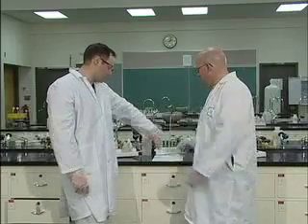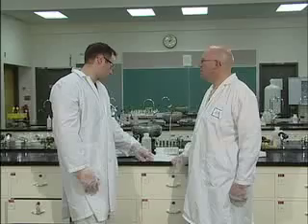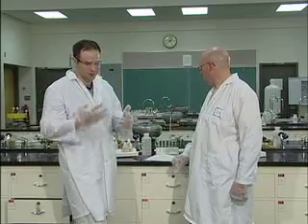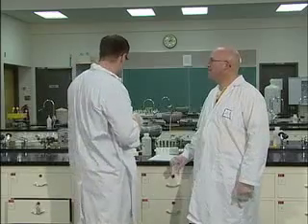Now, next step. Make sure you record all those observations again. You're predicting products and reactants, so make sure you have a balanced equation for it. This one's a pretty simple balanced equation. You should be able to figure it out on your own, but if you don't know, ask. It seems like things are going by fairly quickly. If you think you've messed one up, you can always do it again, just in case you missed an observation. There's lots of magnesium there. Plus, it's real fun. Try the magnesium out.